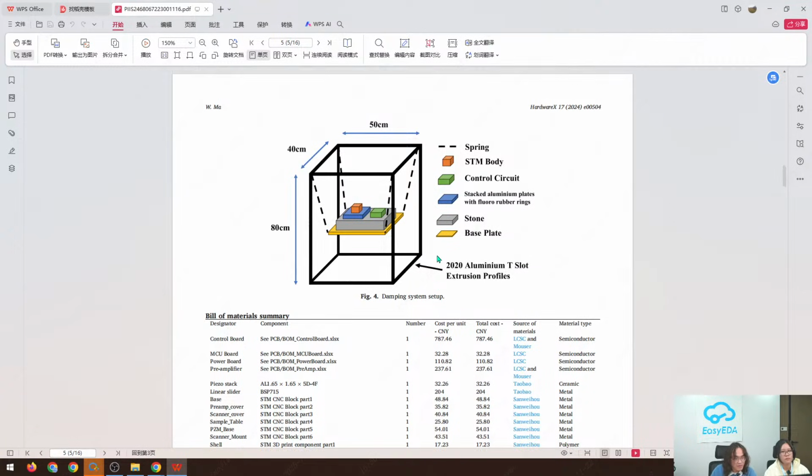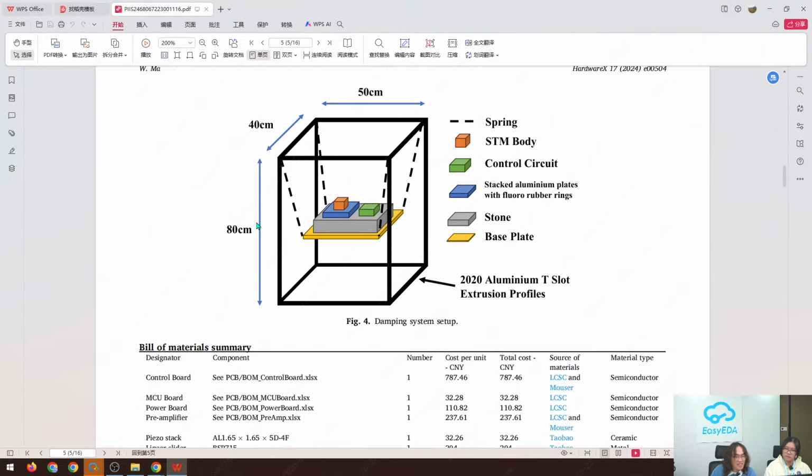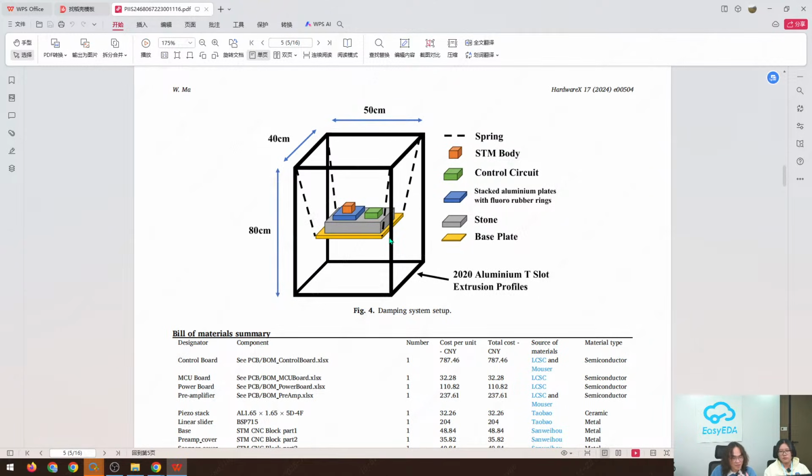Oh yeah, since the distance between the tip and sample is very close, every tiny vibration will cause a shake, so the tip may crash with the sample. In this case, I designed a very simple damping system with 4 springs and a stone, so it can work as a hanging damping system. And in this case, we can get a very low resonant frequency. Still, it's a very simple damping system.